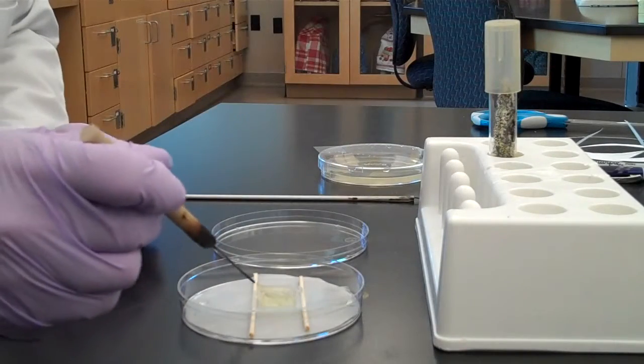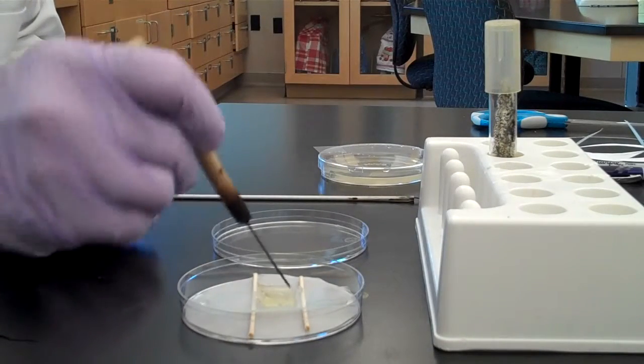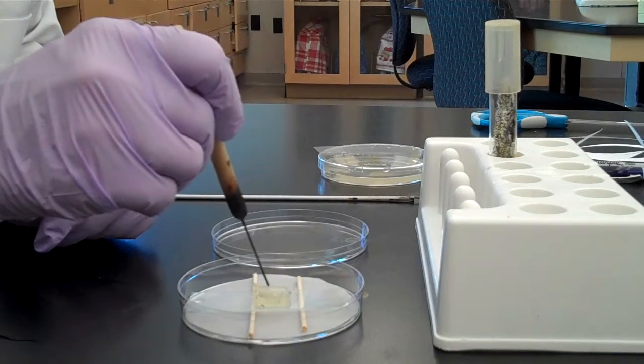Transfer the spores to each side of the agar block by touching the dissecting needle to the edge of each side.